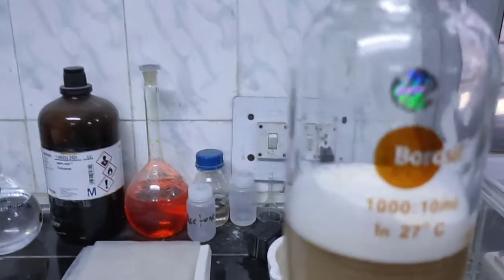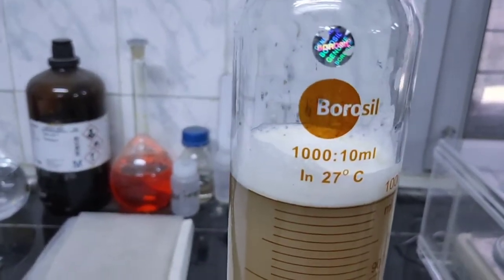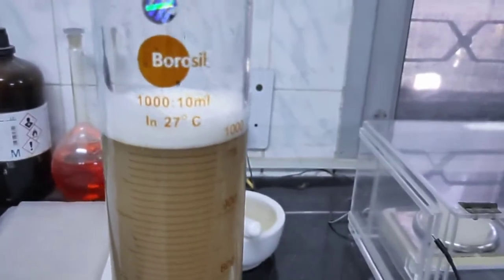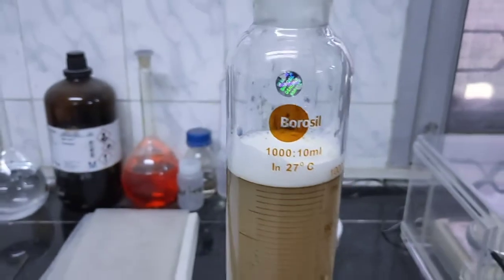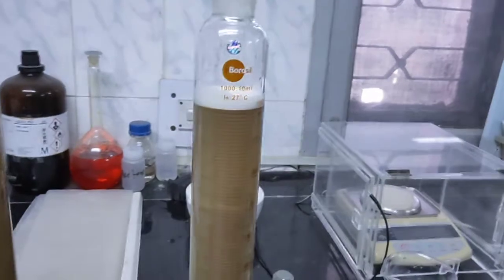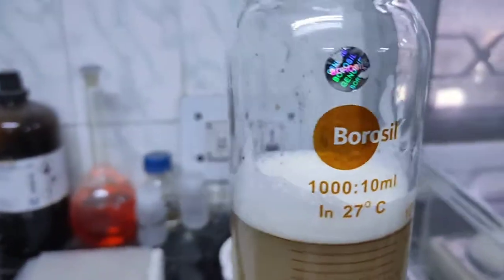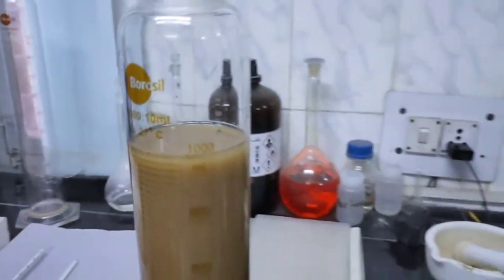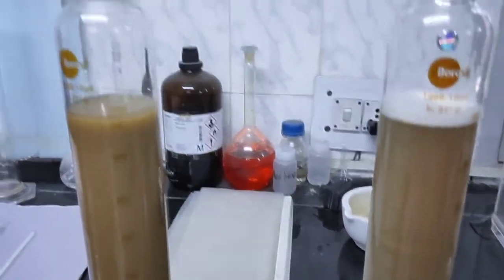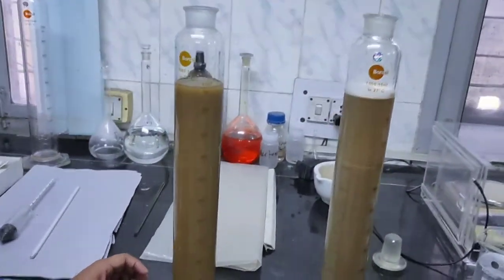You can find there is still some froth remaining. We may or may not remove it — we can simply leave it — but it is better to remove this particular froth so that it does not disturb the reading.